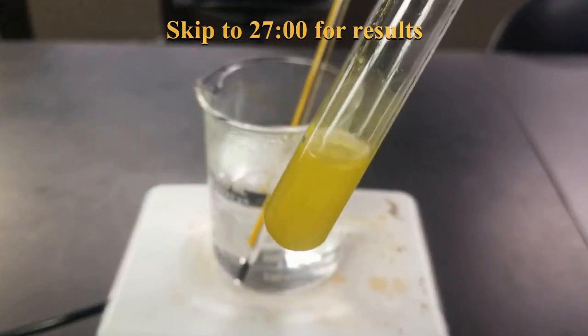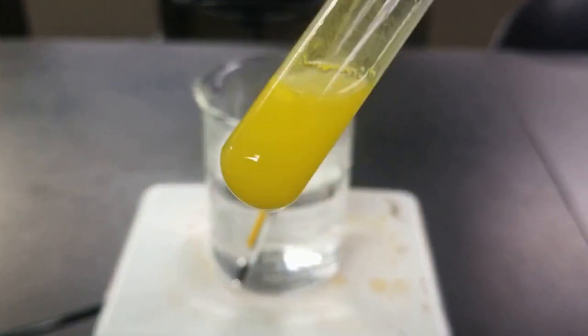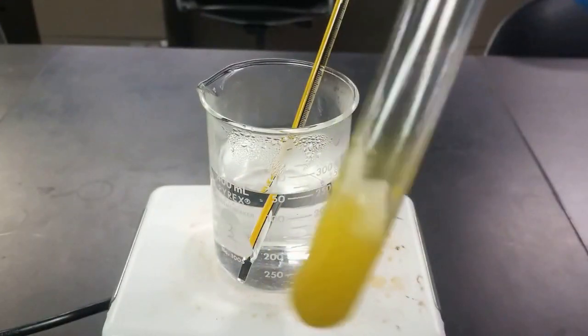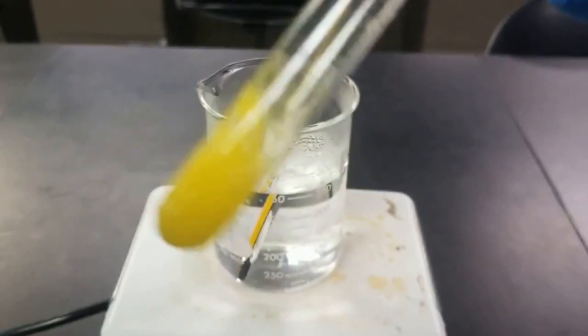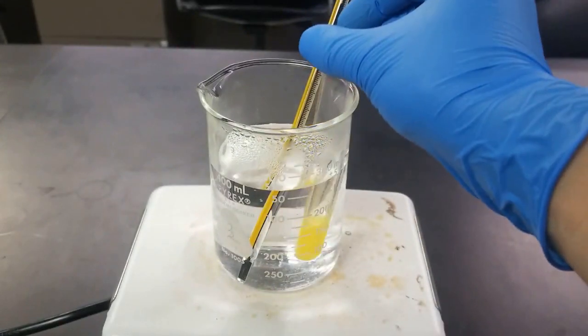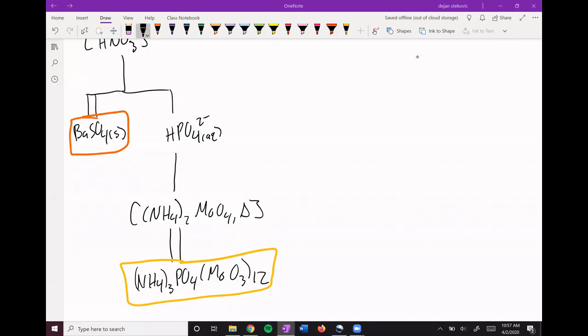You can see my solution is getting cloudy. That is indicating the formation of a precipitate. Yeah, it's gone full on cloudy now. You can see some precipitate on the edges and stuff. So whatever's causing this yellow precipitate, it's definitely there in our known, as it should be. All right, so at this point, you can see we're kind of done with this tree over here. We've taken care of both the sulfate and the phosphate.